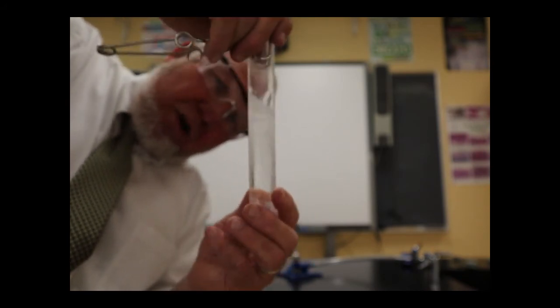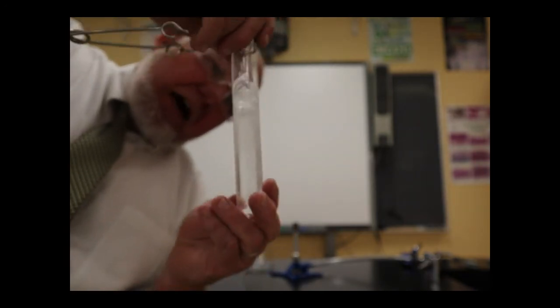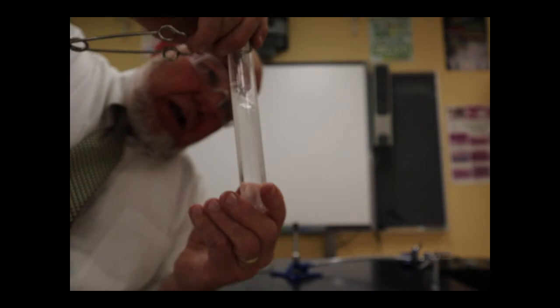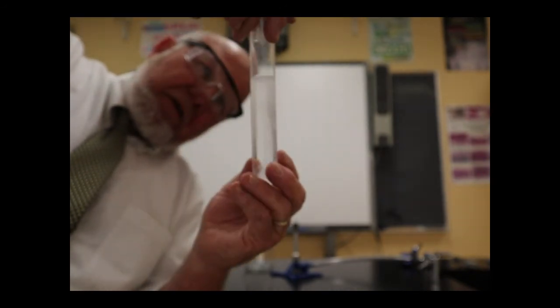And you know how when you turn on your faucet, sometimes the water comes out fast. The water looks all cloudy, and then eventually it settles and it gets clear, and that's because the dissolved air in the water has risen to the top and come out. And doggone it, I see that piece of magnesium there, and it's just not going to give me a break. It's just about this big right now.